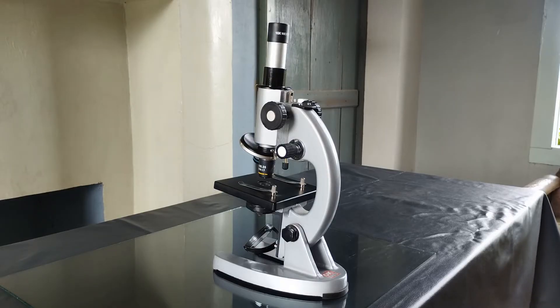If an external artificial source of light such as a table lamp is to be used or the microscope comes with an inbuilt light source such as LED or halogen lamps, then location of placement doesn't matter much as long as the light source is positioned correctly.